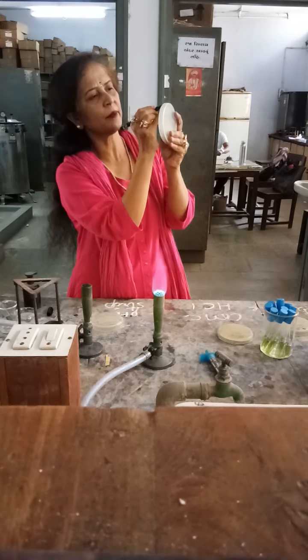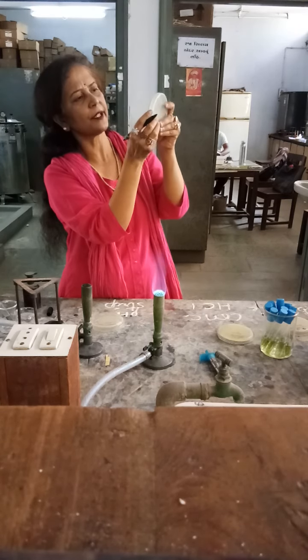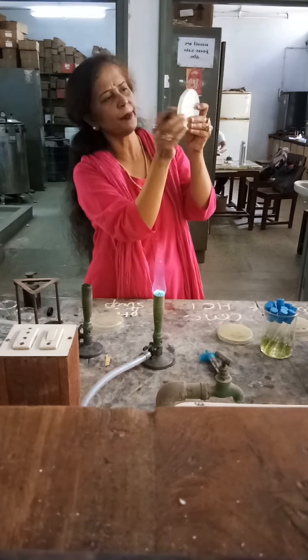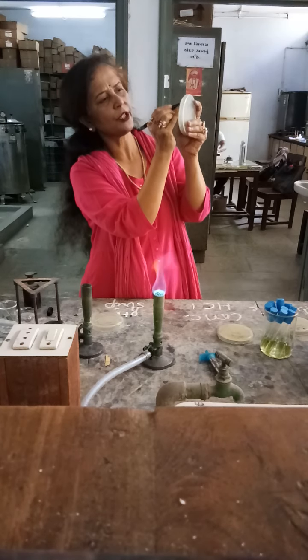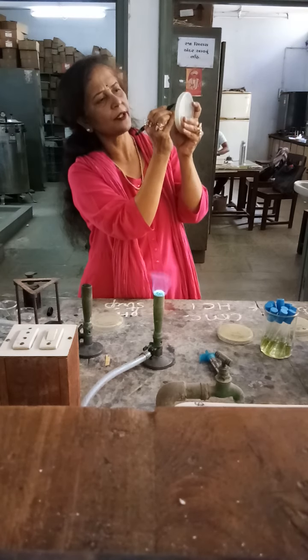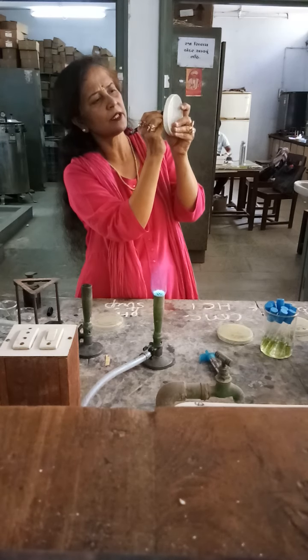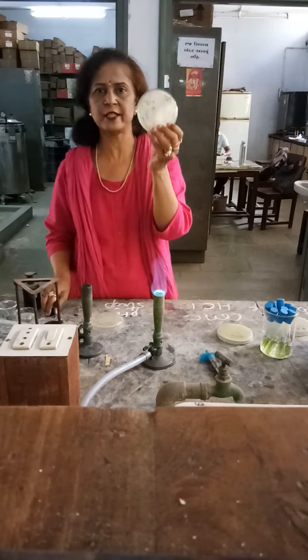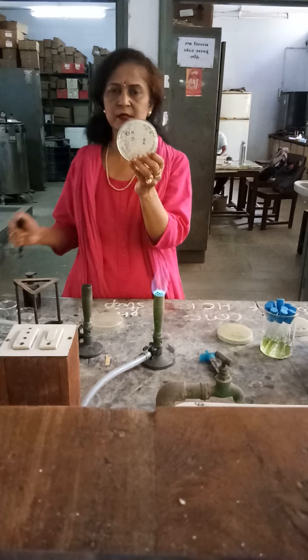After marking them, we will write down the colony characteristics and carry out gram staining to identify the bacteria. After identification, we will pick up this colony and transfer it, giving a broth culture on a slant. That slant will be preserved for a longer time period for further study such as secondary screening or other analysis.